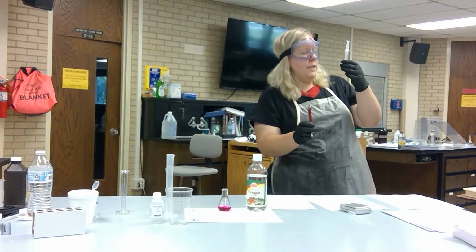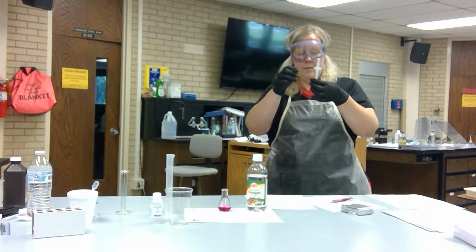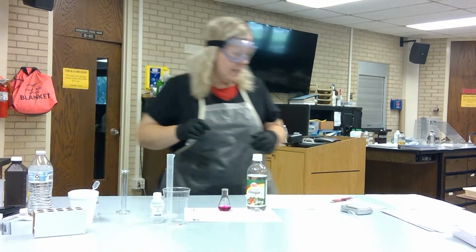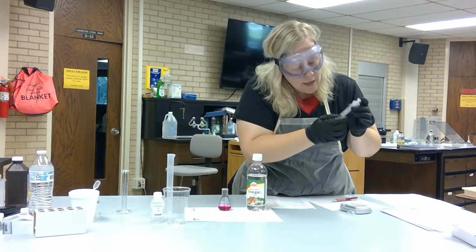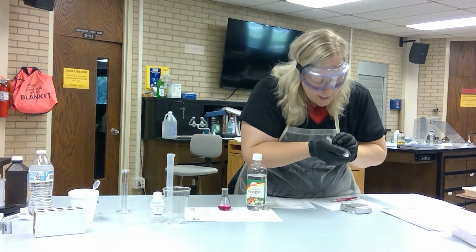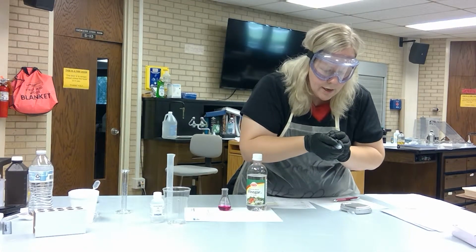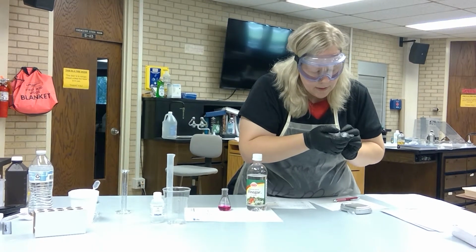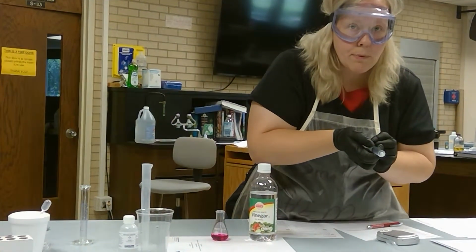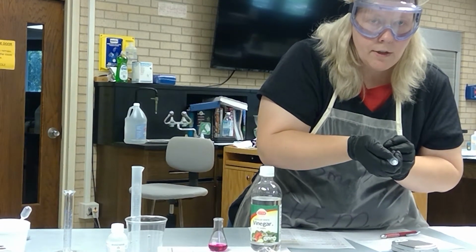And make sure that you do read these correctly. So I went ahead and, there we go, let you guys kind of figure that part of it out. Okay, just to make sure, I'm going to go ahead and pull this up a little bit. That line right there, that's your 0 milliliter line. That means there's no more base to be added. At this line right here, let's see, so if you're up here, that's your 10 milliliter line. So there you've added 1 milliliter, and you've added a second one because remember we're pushing down. So in here, that line would tell you how many milliliters are present in the syringe.